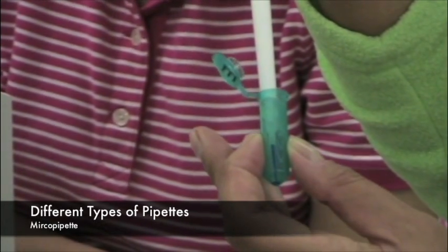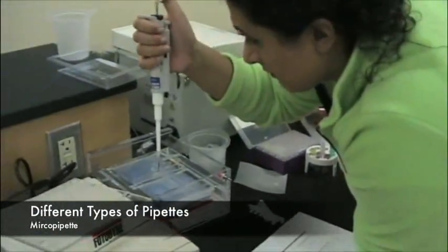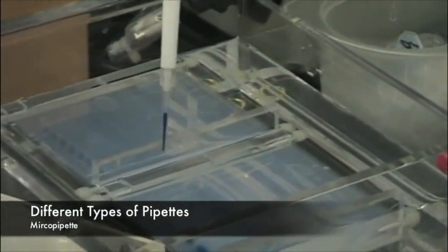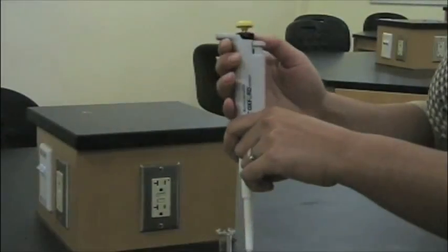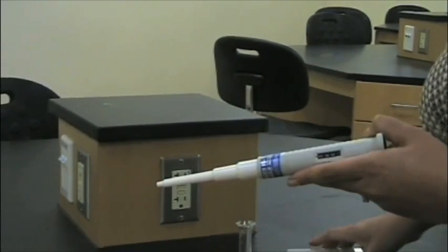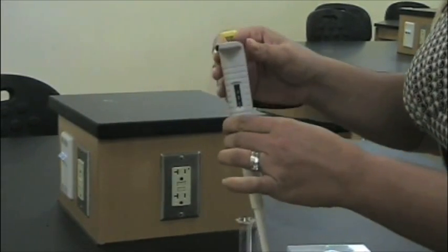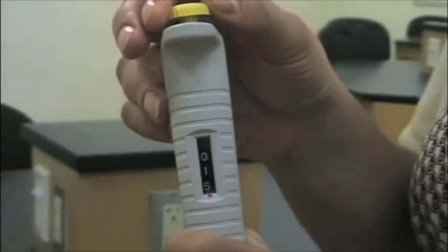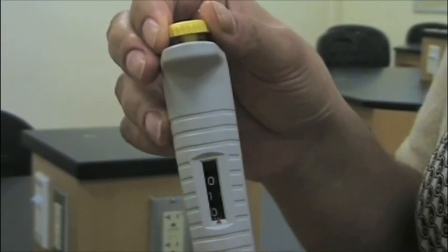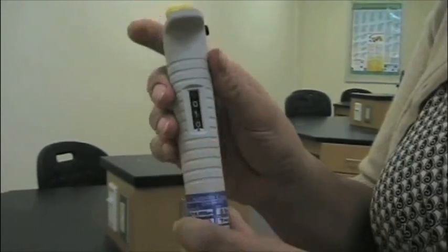The micropipetor has the ability to measure volumes accurate to one microliter — one thousandth of a milliliter. One microliter is so small that it is nearly impossible to measure it in a freehand measure. So in order to draw and dispense such a tiny amount, a more accurate device is needed. With a micropipetor, a method called air displacement is used. Micropipetors come in different varieties. Our goal in this project is to show you the use of a single channel pipetor. Adjusting the volume on the micropipetor is very important. The dial on top is used for setting the volume — turn it until you reach the desired volume. Below the dial there is a trigger for locking the volume setting. You lock this trigger to secure your volume setting.